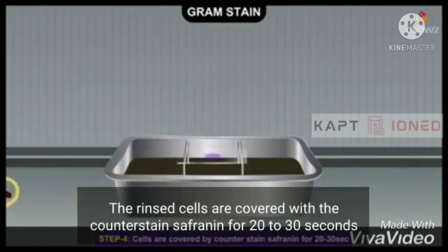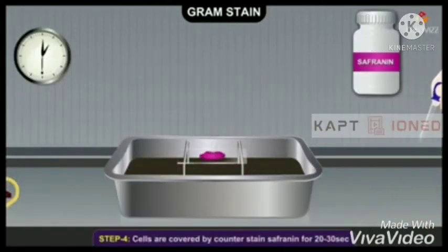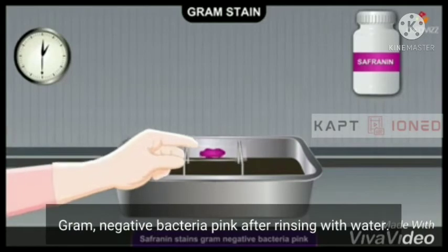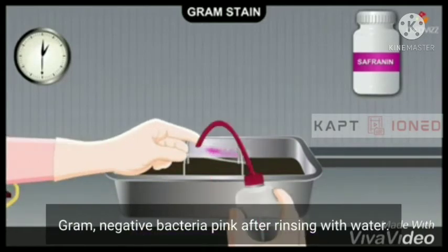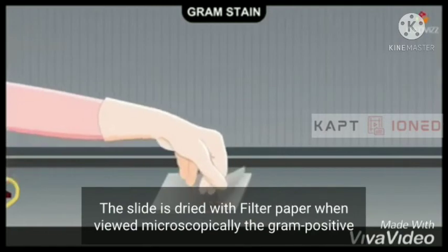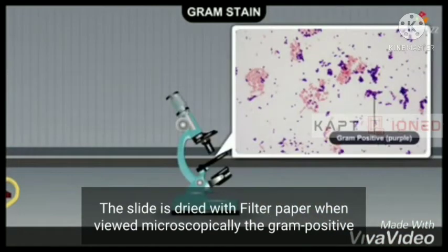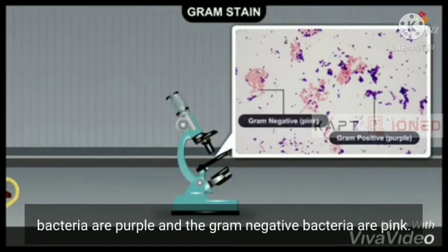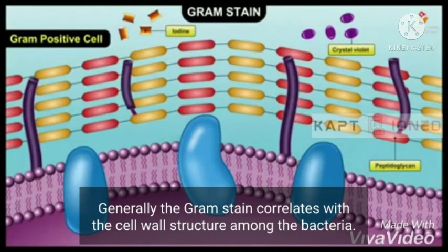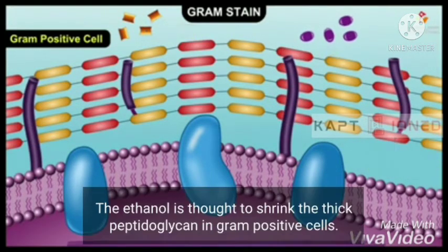The rinsed cells are covered with the counterstain safranin for 20 to 30 seconds, which stains the Gram-negative bacteria pink. After rinsing with water, the slide is dried with filter paper. When viewed microscopically, the Gram-positive bacteria are purple and the Gram-negative bacteria are pink. Generally, the Gram stain correlates with the cell wall structure among the bacteria.